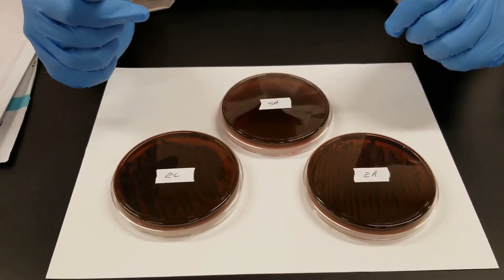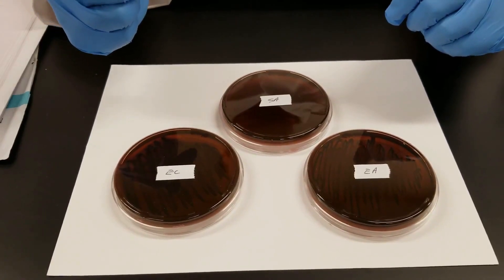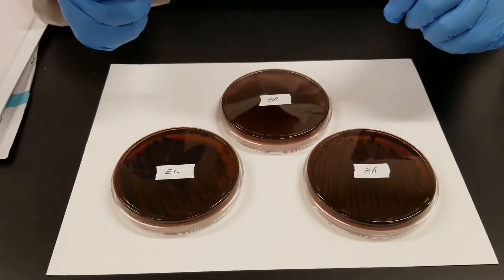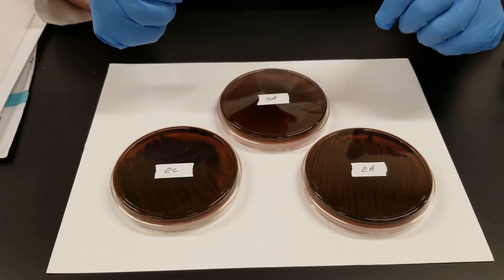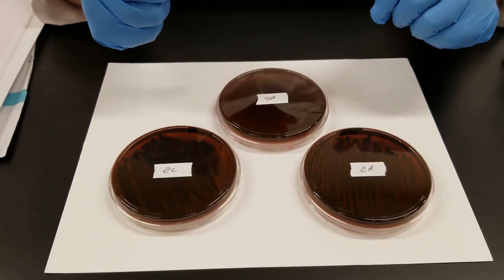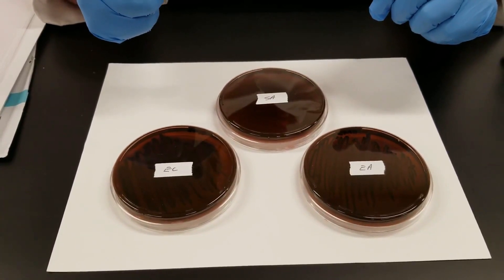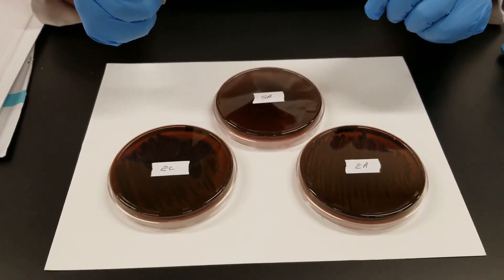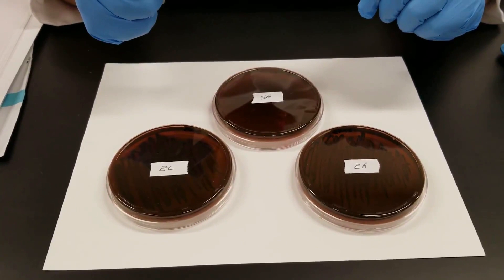This is the EMB plate — eosin-methylene blue. This is also selective and differential media. It is selective in that only gram negatives will grow; gram positives will not grow on this.